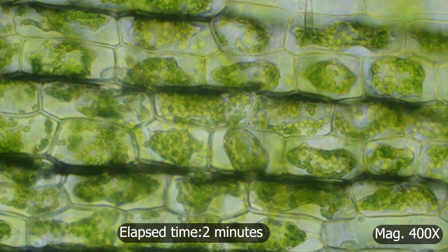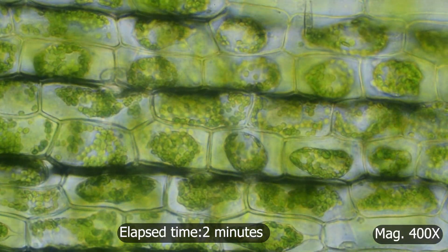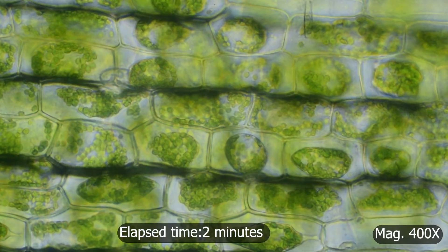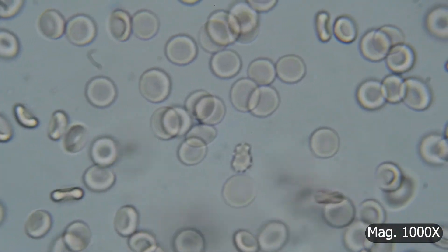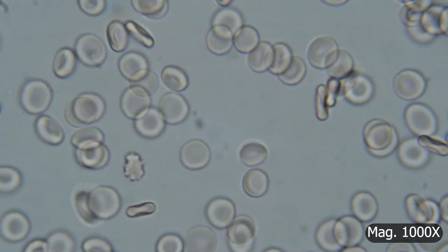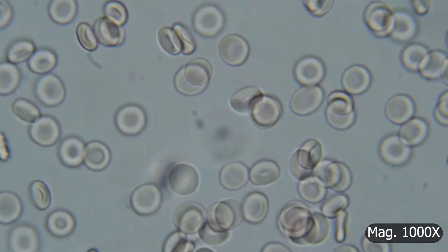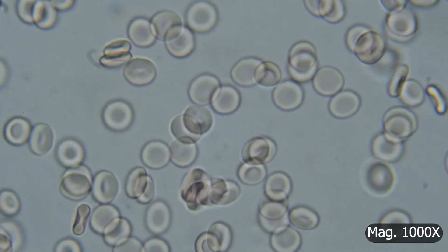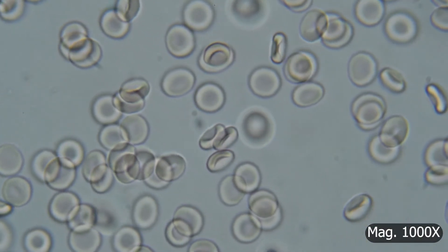This process can also be seen in animal cells. Here are some human red blood cells. Red blood cells have a typical biconcave shape as seen here.